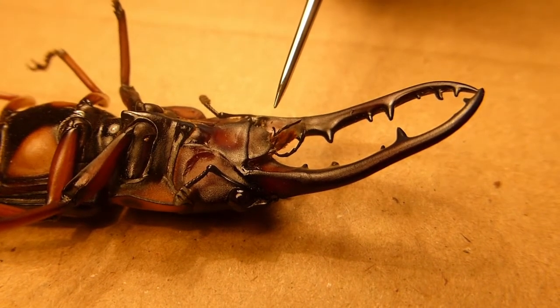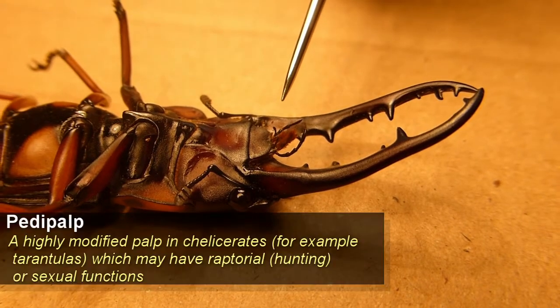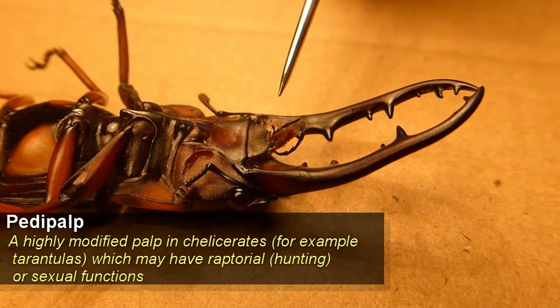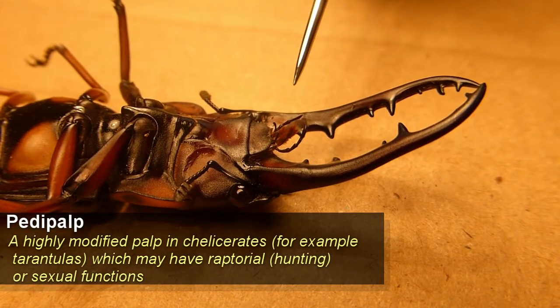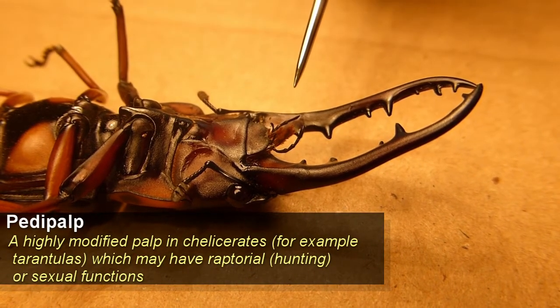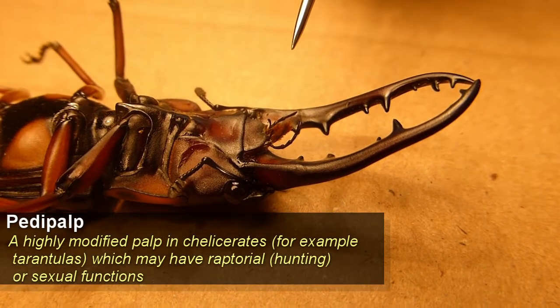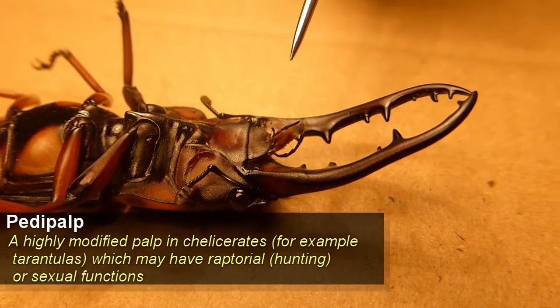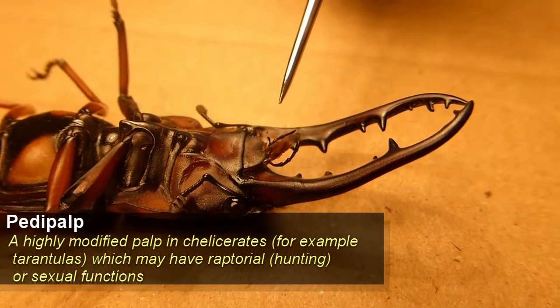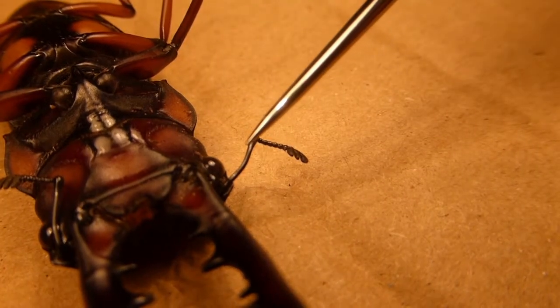Things like spiders and tarantulas have structures called pedipalps, which are highly modified palps that almost act as auxiliary legs. These can be used for anything from manipulating prey to having sexual functions in some tarantulas.